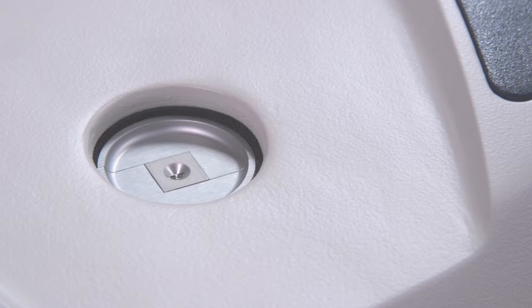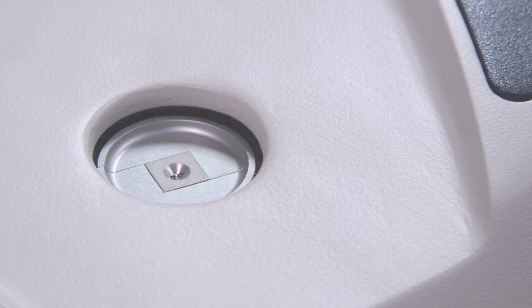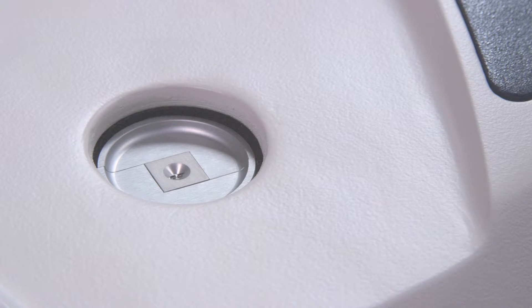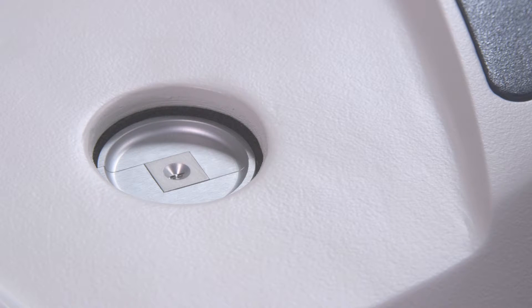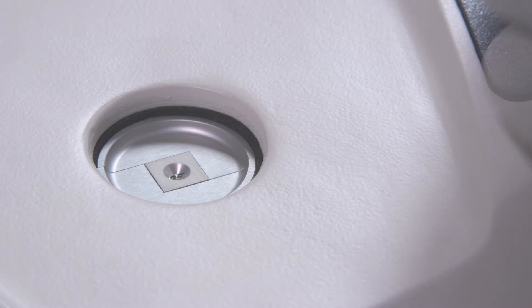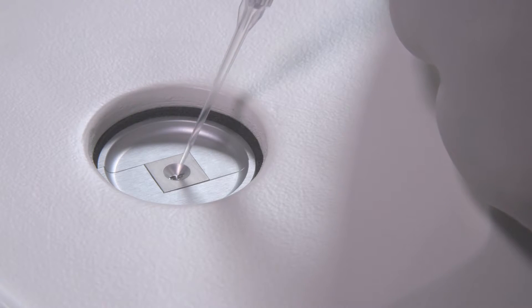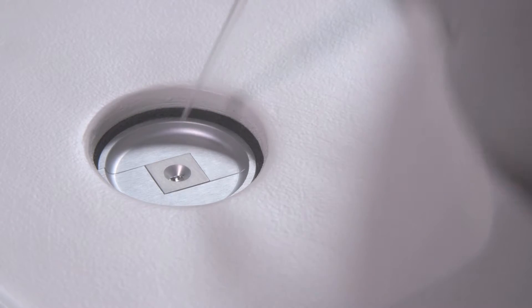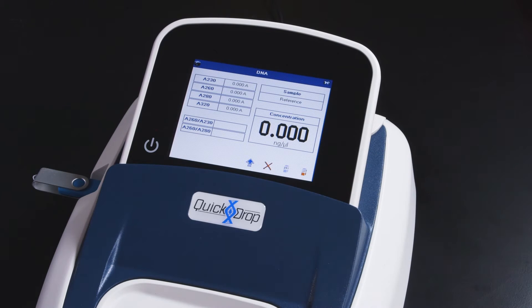Now we'll move on to read our DNA sample. Again, you may load anywhere between 0.5 and 2 microliters of sample into the microvolume sample port. Once the DNA has been loaded, select the read sample icon.